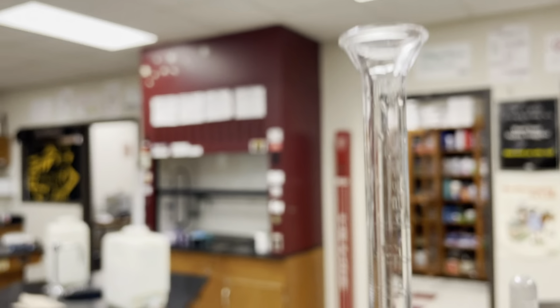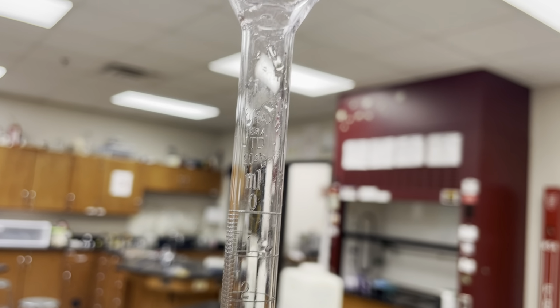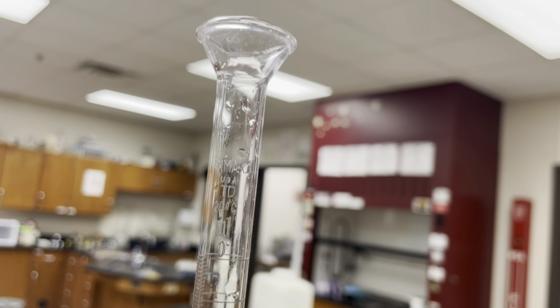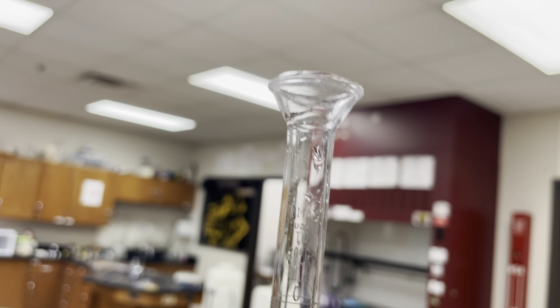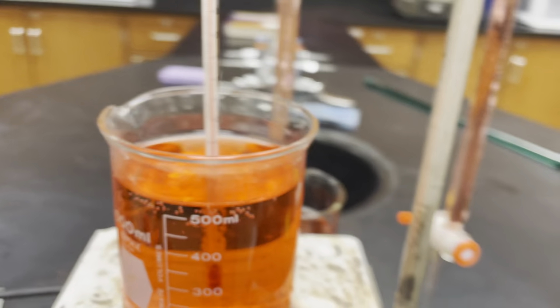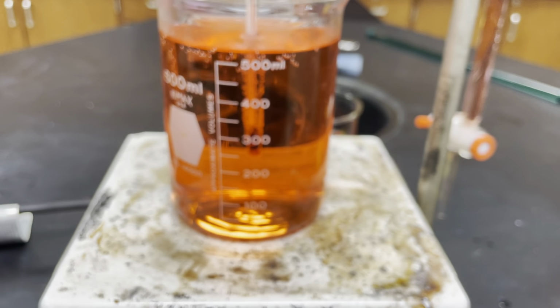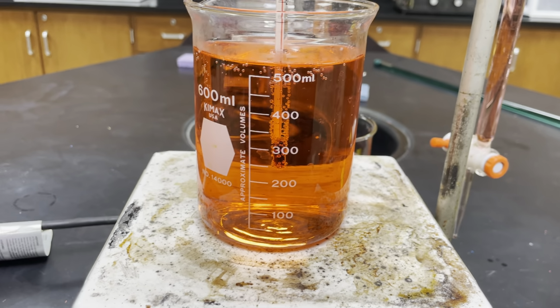So on your burettes, you have a mark for 0.0 up here, but we don't want to try and guess and say, well, if you're above that, maybe it's at negative 1.0 or negative 0.5. We just can't tell for sure, and the glassware isn't calibrated to be like that. So it's not really safe to make a measurement being so cavalier about it.